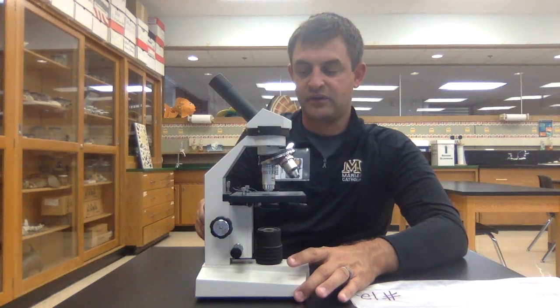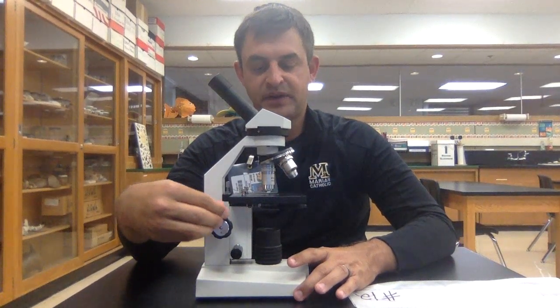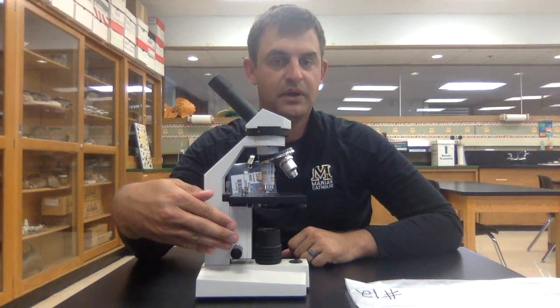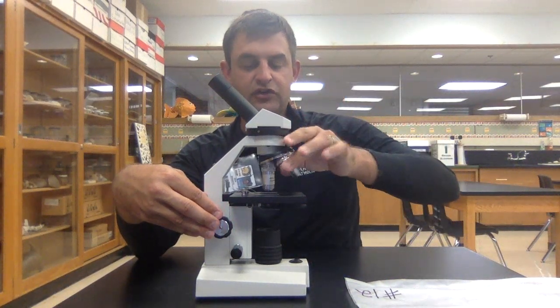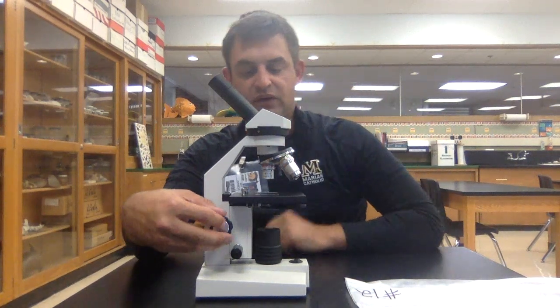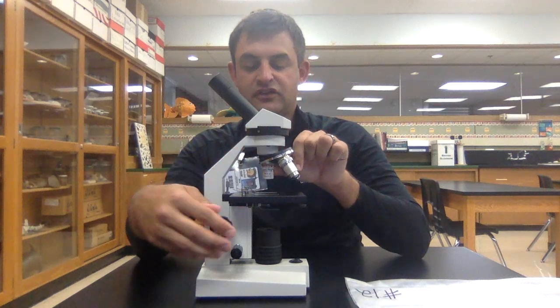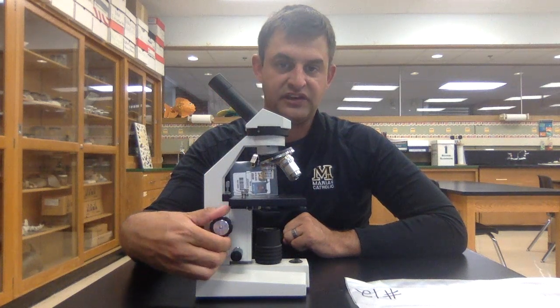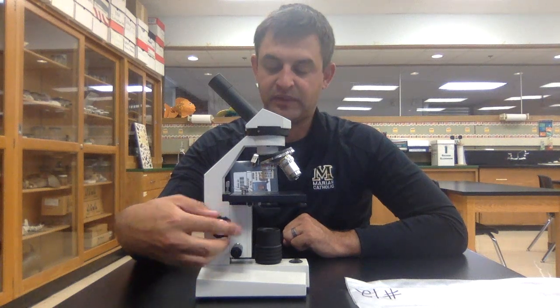That brings us to our controls, which are coarse and fine adjustment knobs. This top knob is the coarse adjustment knob. When you are on high power, you don't touch this knob. This knob moves the stage a great deal, so you can only use the coarse adjustment knob with scanning or low power. I'll show you how much this moves the stage — it really makes big changes in the height of the stage, and that's important for magnification.